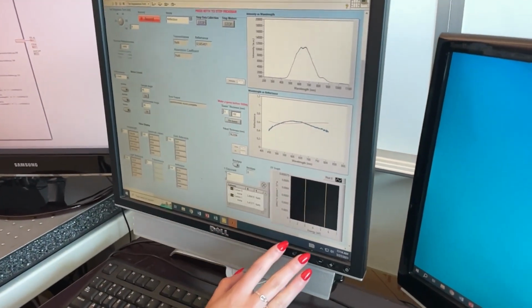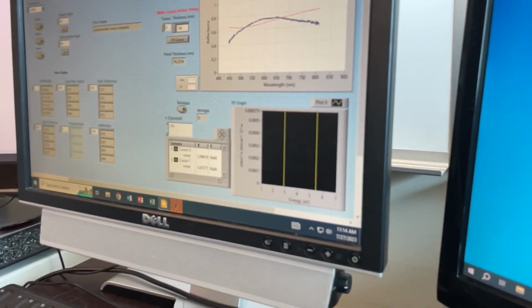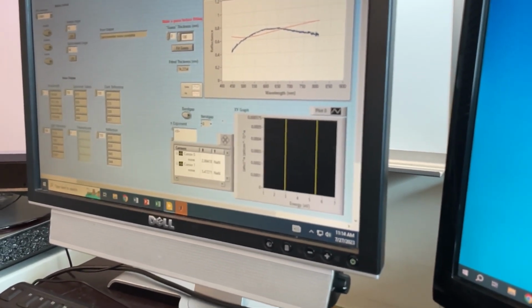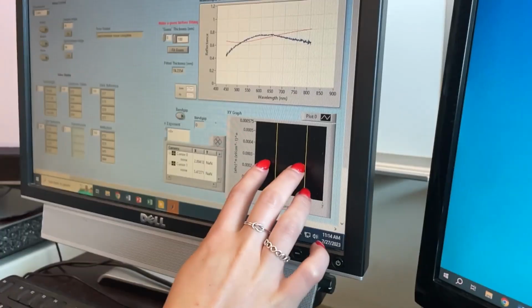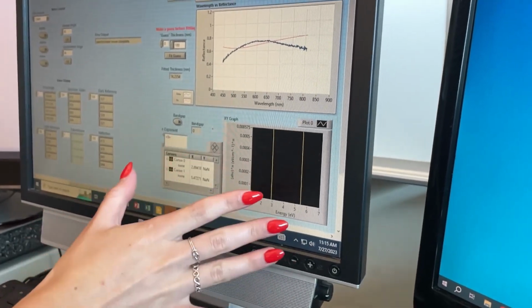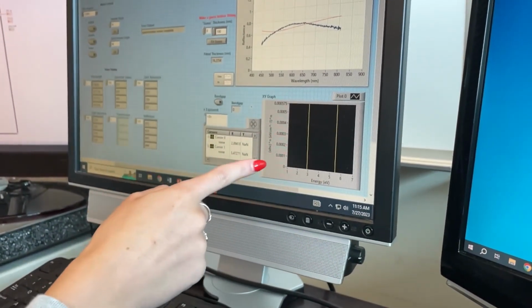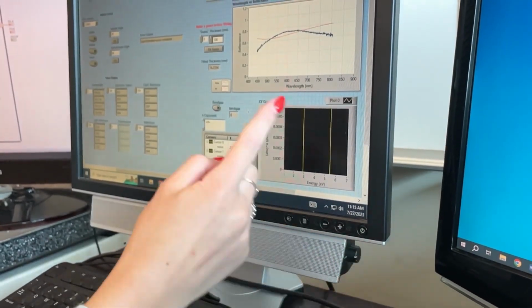Another feature of this that's not fully developed yet is the band gap feature. Now for this, if you want to run it, all you'll have to do is press this button to turn it on, and then select the N exponent, whether it's direct allowed, indirect allowed, etc. A graph will display on here, and then you can move these cursors around, and it will display the band gap here. Now the reason why this isn't functional yet is because we have not figured out how to take a transmission measurement, and this is reliant on transmission. But once that is recorded, this will be functional.